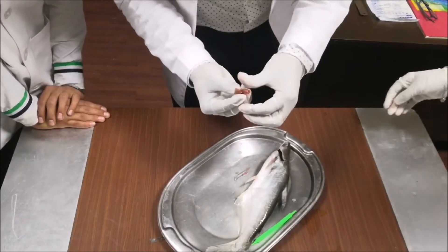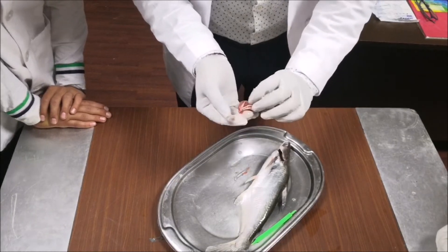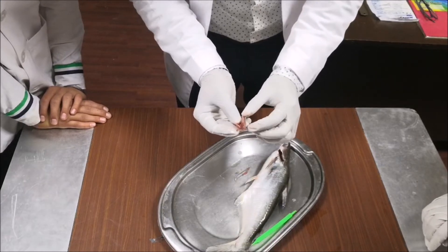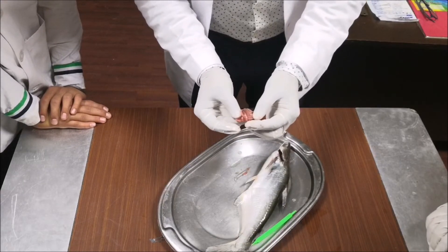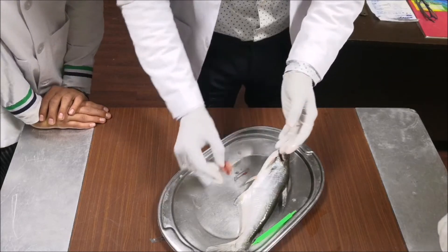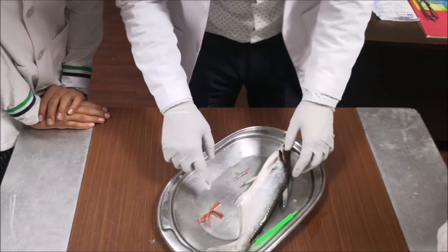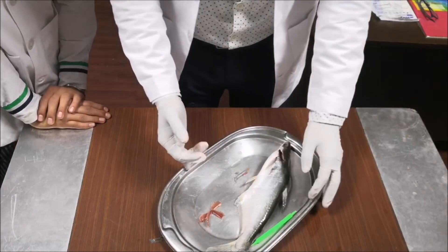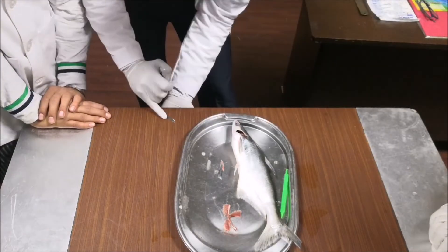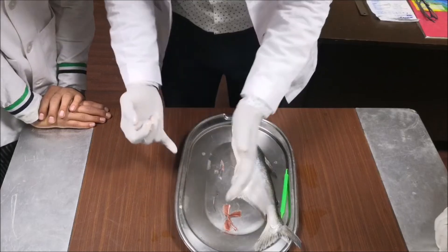See, these are fin-like structures. This area basically helps in exchanging the gas. Which gas? Oxygen — which is mixed in water. So these are basically the gills, which are present in fishes, by which they breathe and can respirate. That means they are exchanging oxygen which is mixed in water.